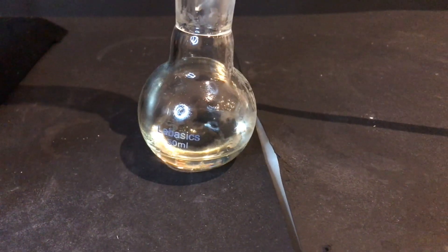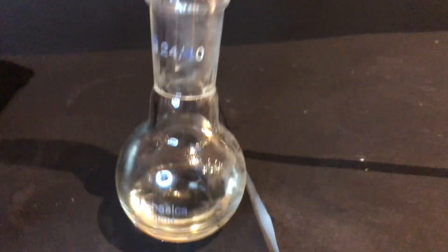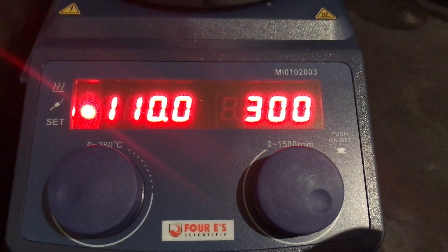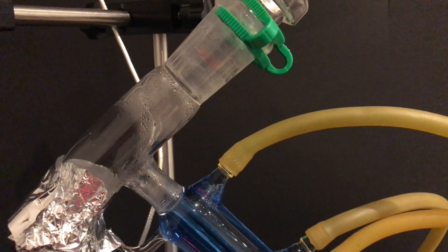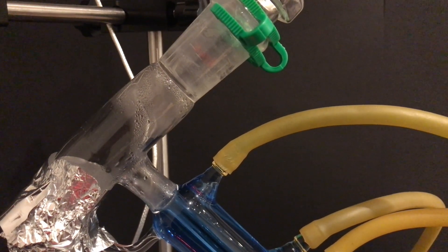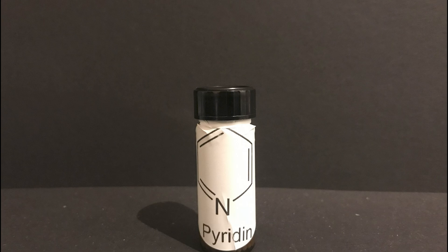In the receiving flask some pyridine was collected, and knowing it wasn't pure, I thought about redistilling it with a short path distillation apparatus. The final yield of the pyridine was 21 ml. I stored the pyridine in a tiny vial with some 3A molecular sieves to dry it.